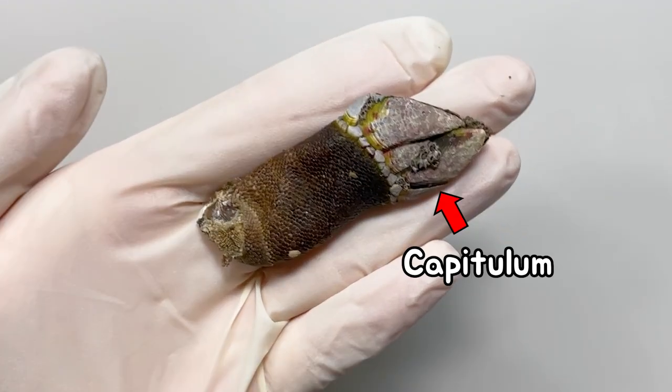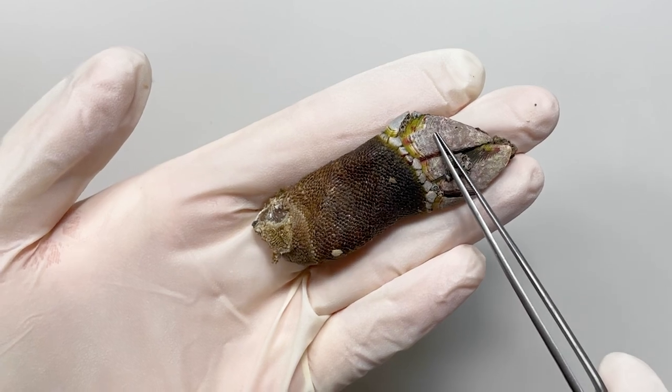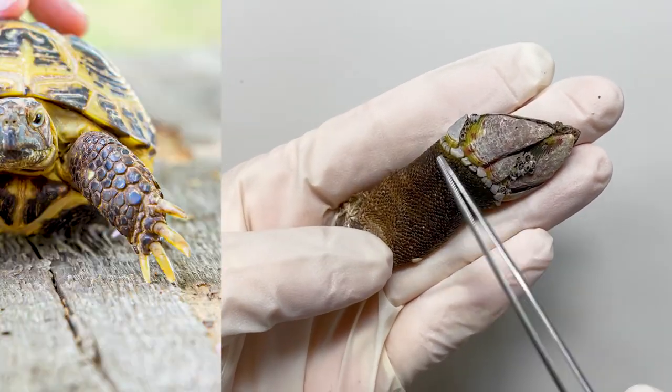The body of the gooseneck barnacle consists of a capitulum and a stalk covered with several calcareous plates. This part looks like a claw, and this is why it looks like a turtle's hand.